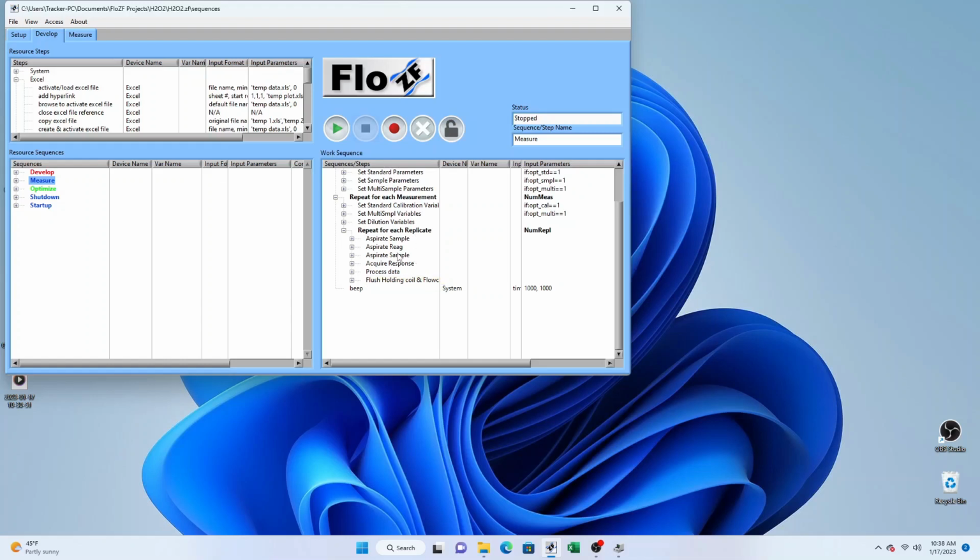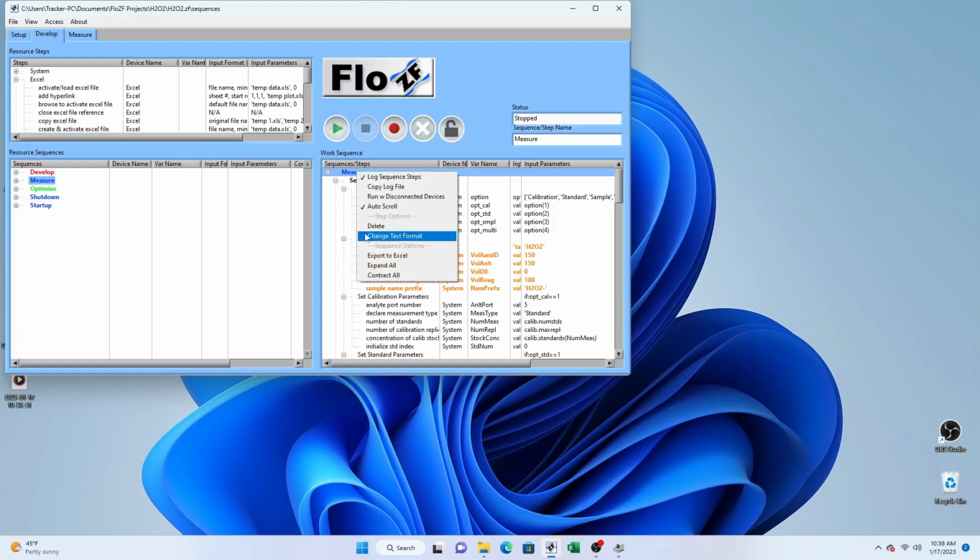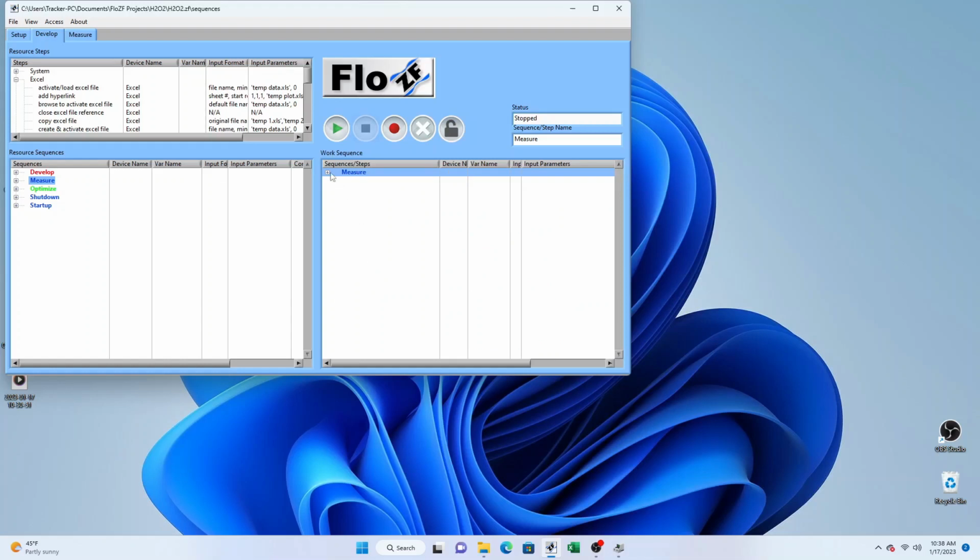When the number of replicates of a particular set of conditions have been completed, we go to repeat the next measurement. When all the measurements have been completed, the sequence ends with a beep of the speakers to draw attention to the end of the measurement. At any point, we can have a look at the entire sequence by right-clicking on the sequence, and then selecting Expand All, or we can contract them and then just open up particular subsequences that we're interested in.